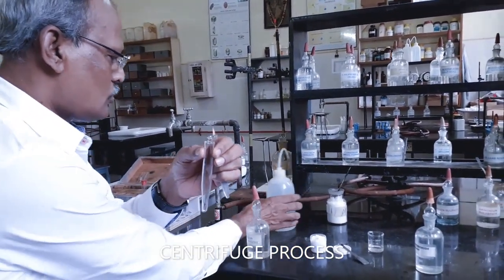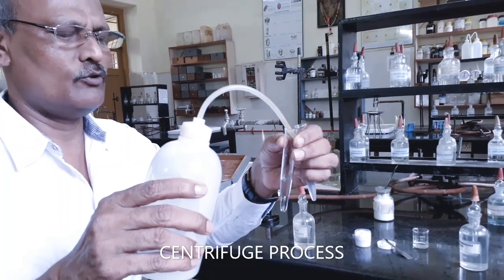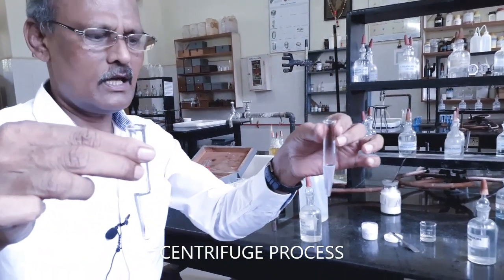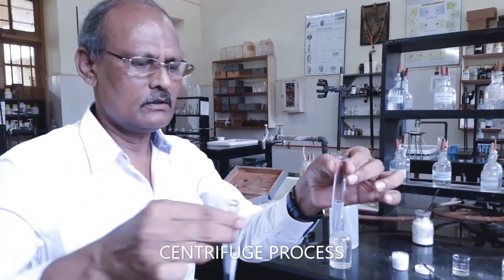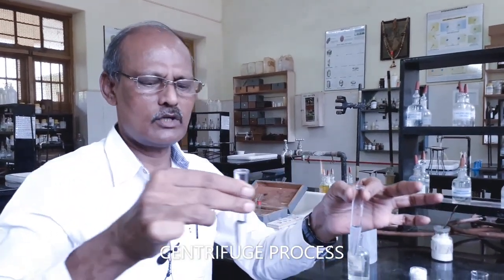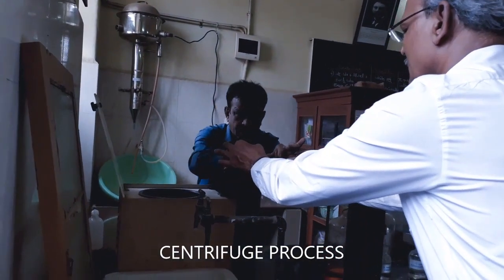In the centrifuge machine, to balance the centrifugal force, I am going to take almost equal volume of water in another centrifuge tube, and we have to keep this centrifuge tube in the opposite direction to prevent the spilling out of solution or precipitate from the centrifuge tube. We have to keep another centrifuge tube containing equal volume of water.